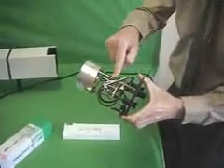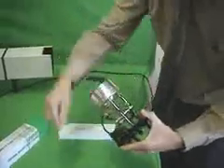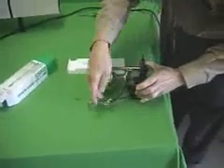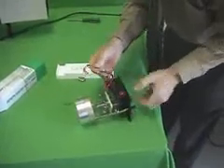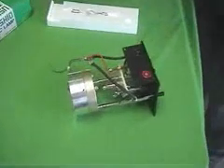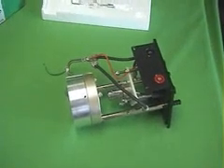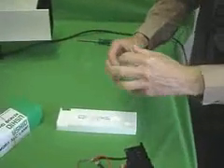When shipped, the anode cooler is tied back to the mounting post with a little tie wrap so that it doesn't flop around and scratch the reflector. Just pull that off and set that aside on the table while you get the set screws out of the small plastic bag from inside the large plastic bag. That contains the set screws for the lamp.